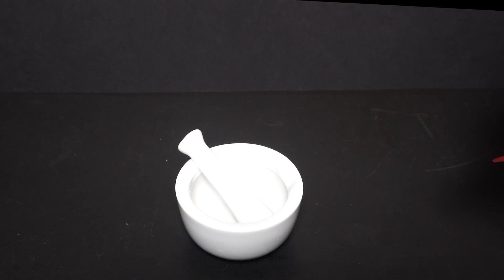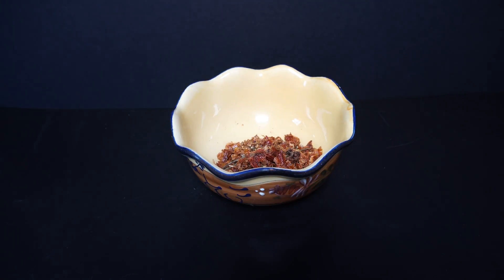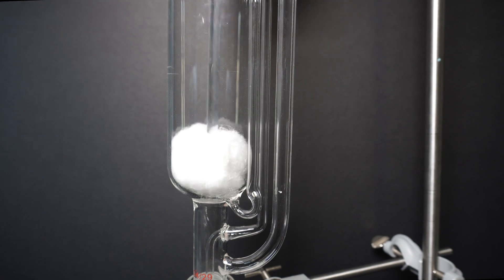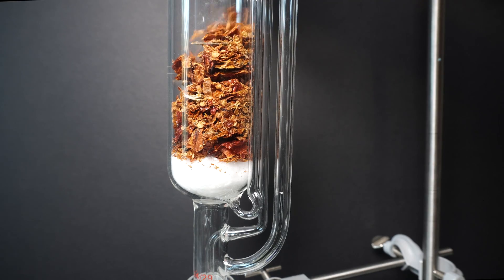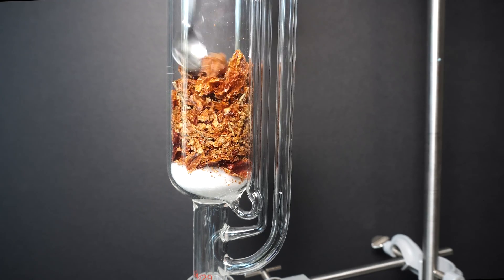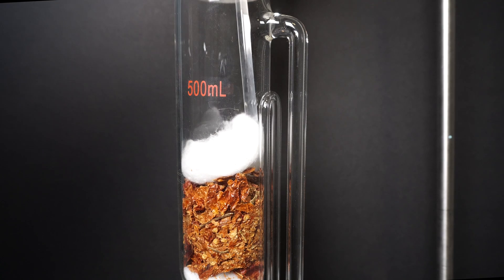After I crush up all the peppers in a bag, I then continue to process the peppers down with my pestle and mortar. It was about at this point I was wishing I had an extra coffee grinder. If you do use a coffee grinder, please be careful about the chili pepper dust that comes off — breathing it in is a less than pleasurable experience. Once the peppers are ground down, we will then need to fill our Soxhlet extractor. There are many benefits to using a Soxhlet extractor: the main one is that you need to use about a fifth of the solvent compared to regular hot solvent washings, and it also saves time on filtering at the end. We first put a piece of cotton in to block the siphon tube at the bottom, followed by adding in our freshly ground ghost peppers. We push everything down to remove as much open space as possible, as any open areas will create air bubbles which can cause problems later. We finish by putting another piece of cotton over the top of the peppers.